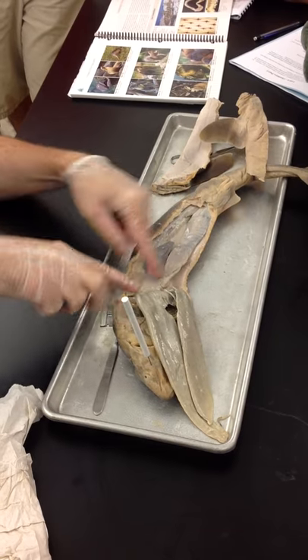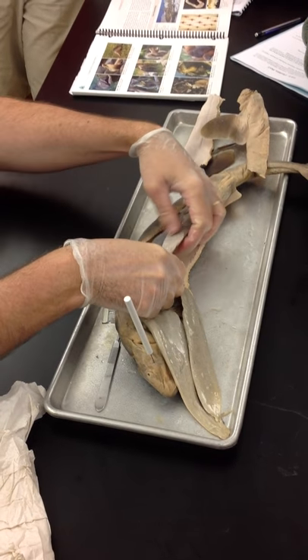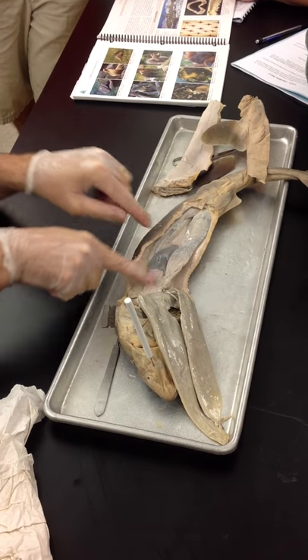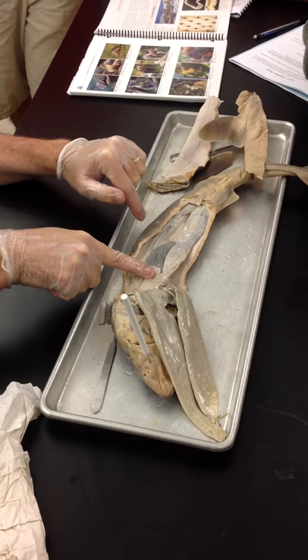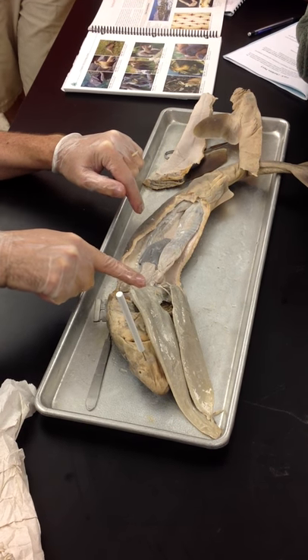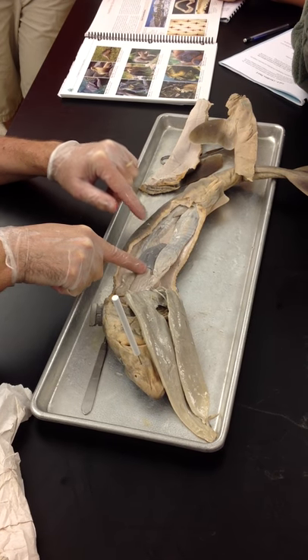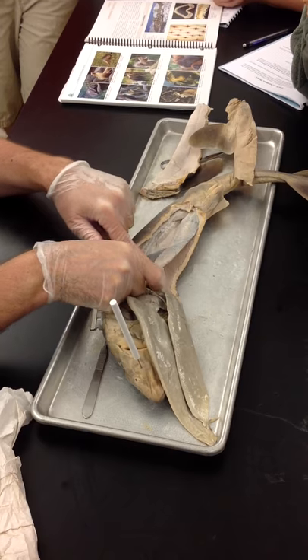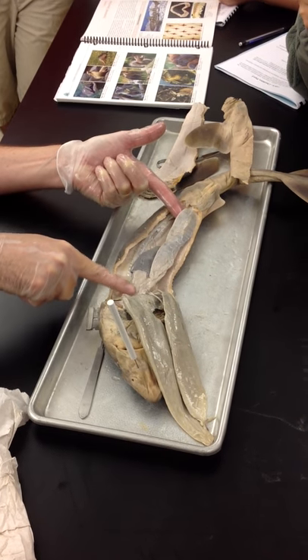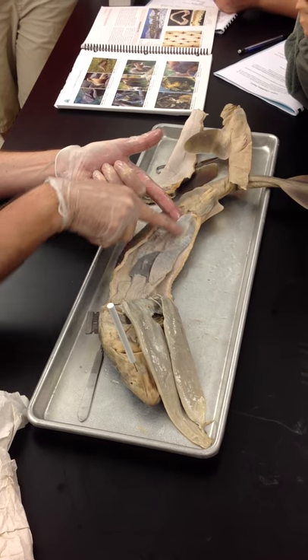Running from the mouth down to here will be the esophagus, which you can't really see. This structure right here is the stomach. If you look at the prepared shark, you see it much better. It then takes a big J-hook, and that J-hook is the ileum, which is part of the intestine. All of this running down is intestine too — so the stomach up high, the J-hook, and this long portion is all intestine or ileum.